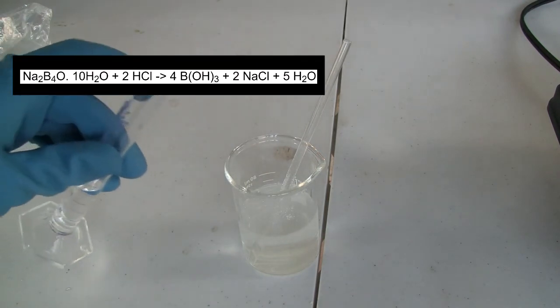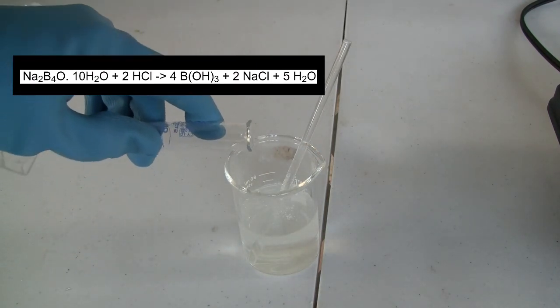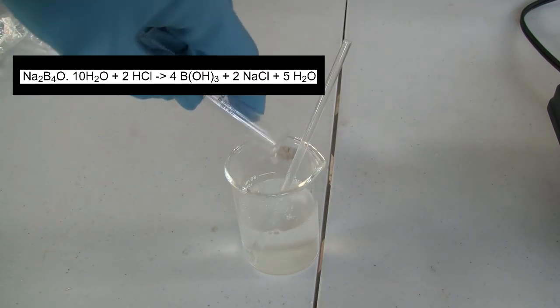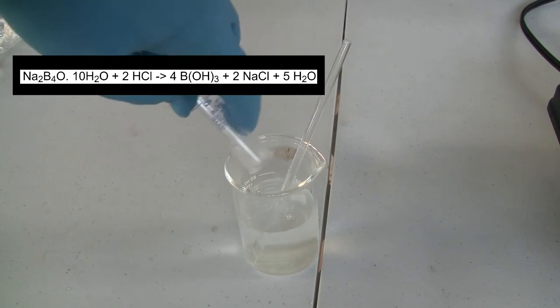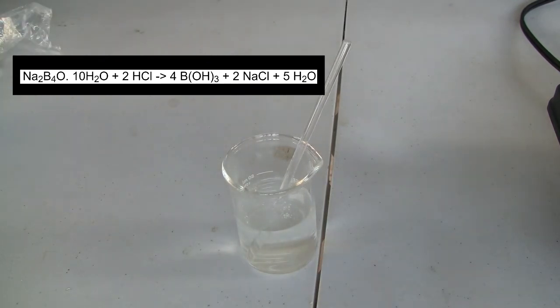Once dissolved, the solution is removed from heat and 5 milliliters of 3 molar hydrochloric acid is added. The solution is then covered with plastic wrap and allowed to cool to room temperature.